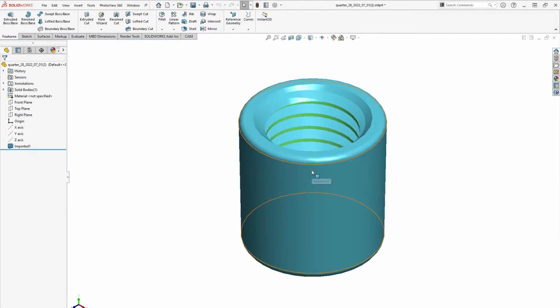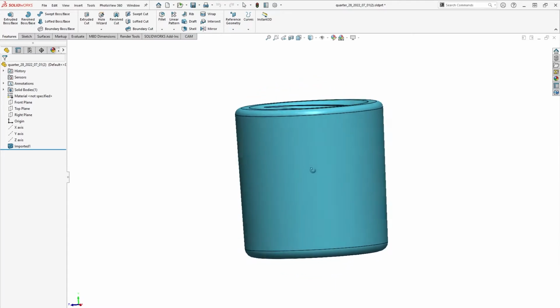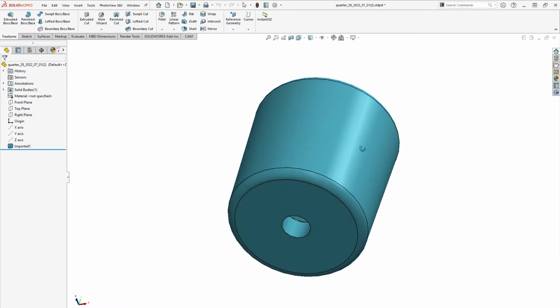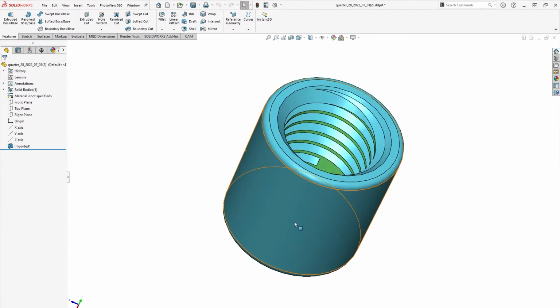Quick side note here, all of our components at Parallel are typically designed for a minimum of 9mm spacing between each other. The same spacing is used in a 96-well plate. It's important to note that you also need to think about the third-party connectors you are going to use with the port when laying out spacing. For example, if you picked a threaded fitting with a big screw head, you'd need to account for that at this stage of the design process.